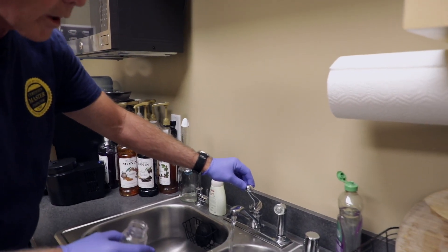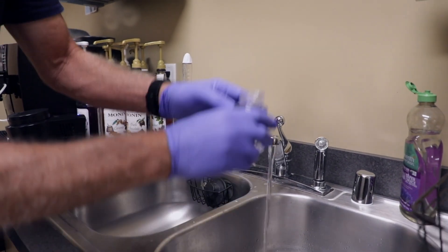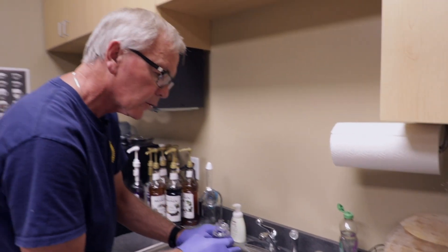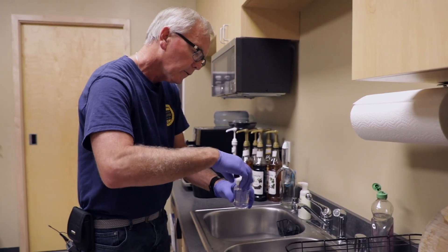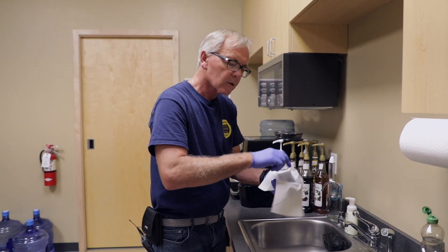So we'll go ahead and turn on the water and let that run in there. We're a little bit over, but that's all right — if it's a little overfilled, don't worry about it. So we get our lid back on here, make sure it's good and sealed, and dry it off a little bit on the outside.